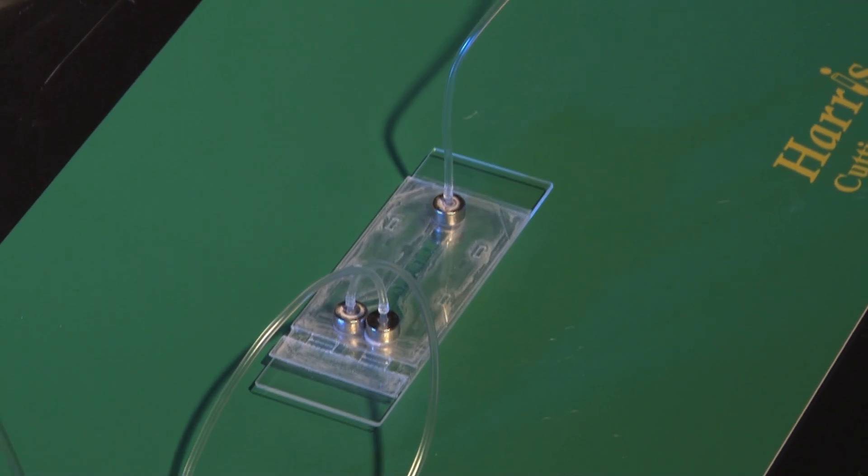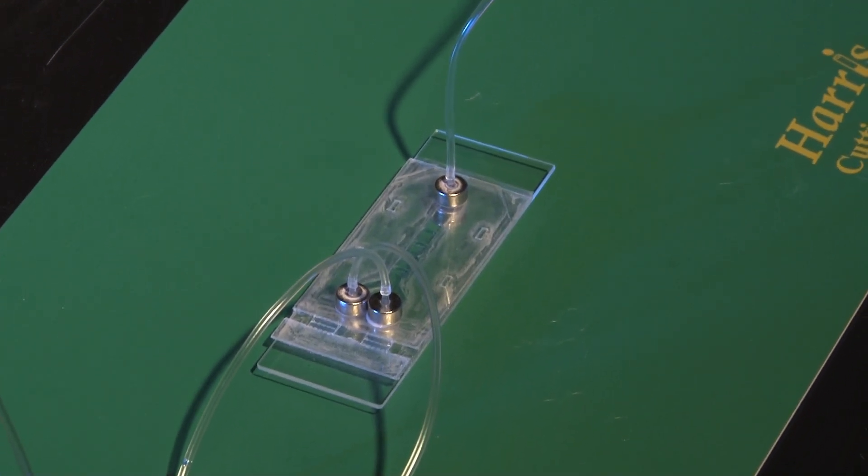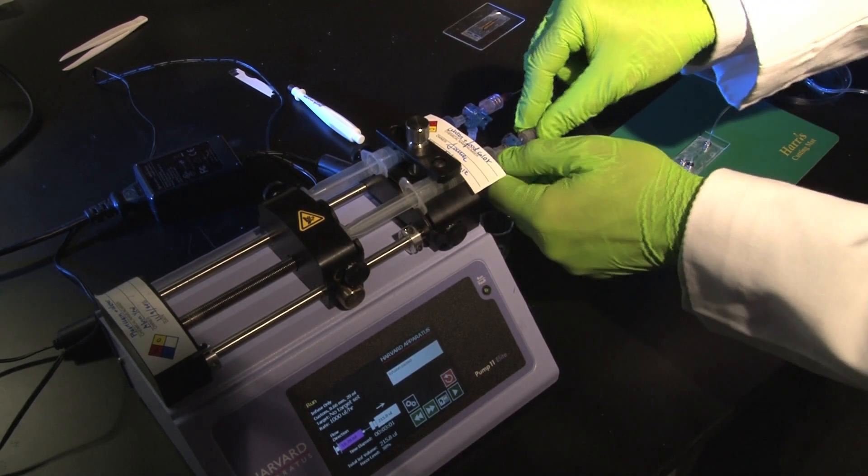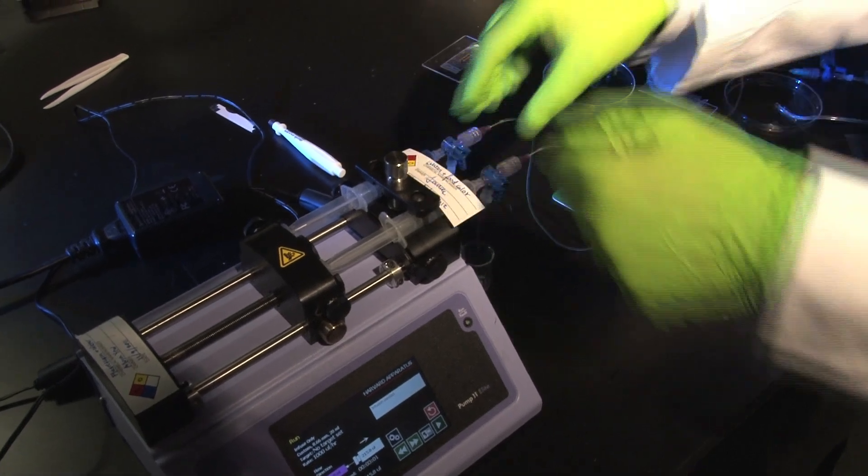So the chip is now fully assembled. The upper channel and the lower channels are filled with liquid and at this point I can just turn on the pumps.